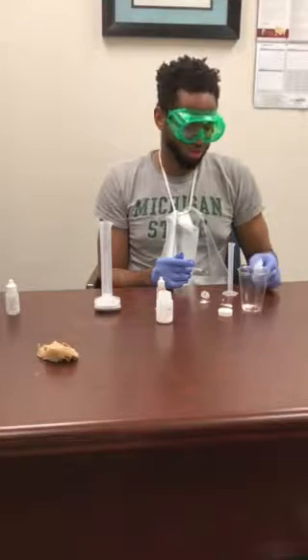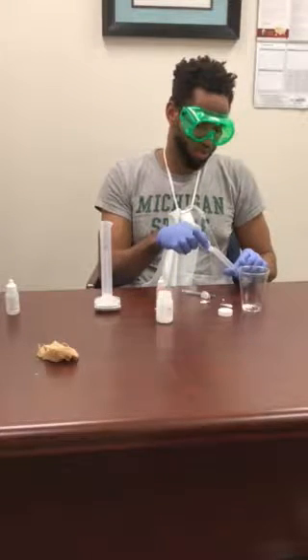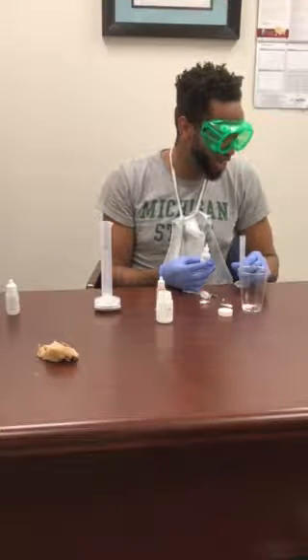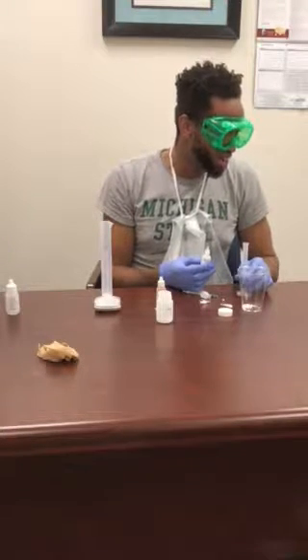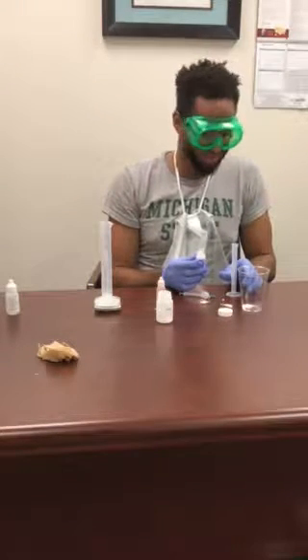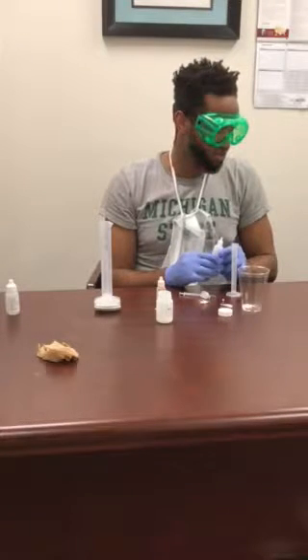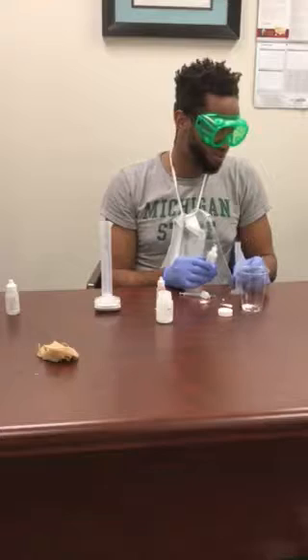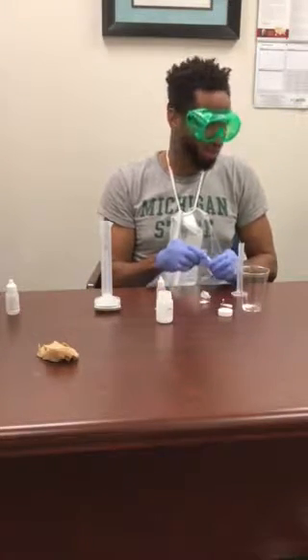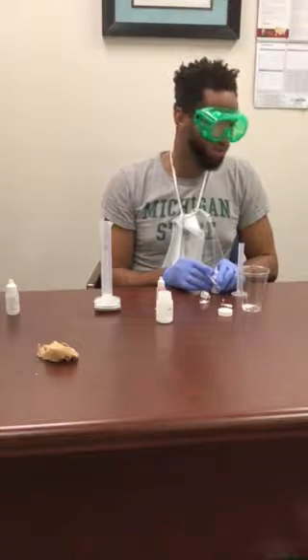Right, so how do I just put this in there? Yeah, I mean, we could use the flask, the little graduated cylinder. That'd be good. Just put some in there. Is this right? Fill the syringe with it. Yeah. Hold on. Same for the syringe. Is it wanting you to put it directly inside the little flask? I don't think you can get the amount.